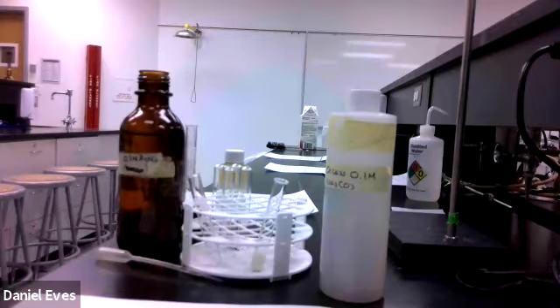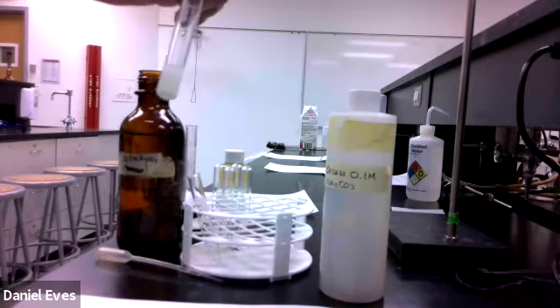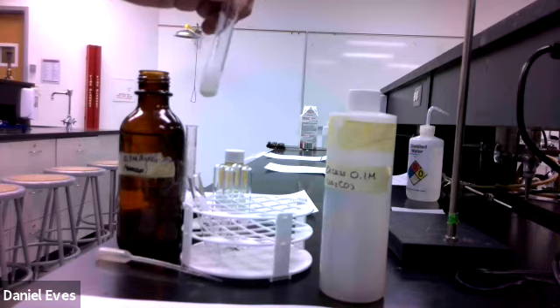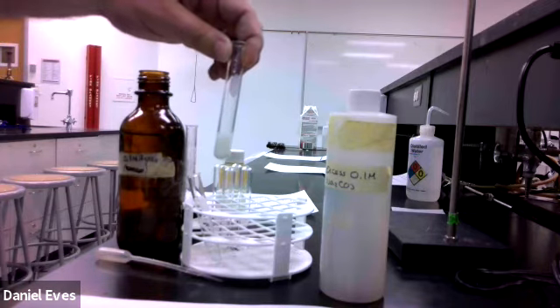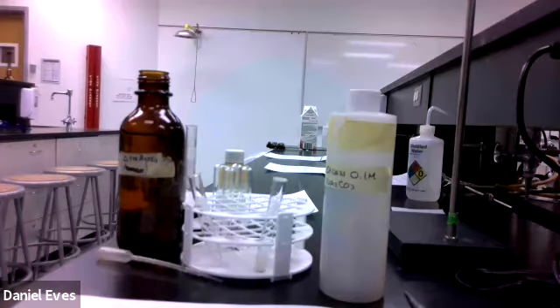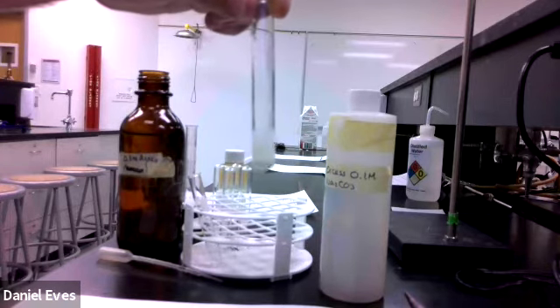Okay, so hopefully you figured out that we do have a precipitate here, and it's starting to settle out a little bit. We're going to give this a little more time to settle out, so we'll stop for a moment and then come back when this is set. Okay, we've let it sit for a moment, so let's have a look. Hopefully you can see the distinct band of solid there at the bottom.